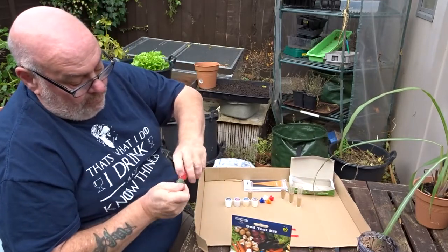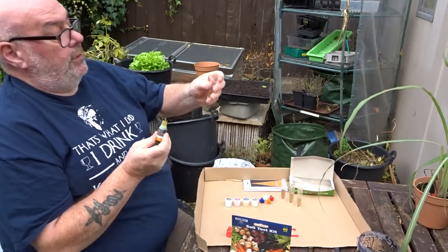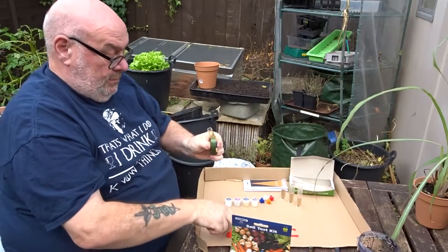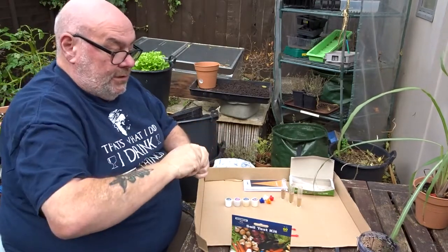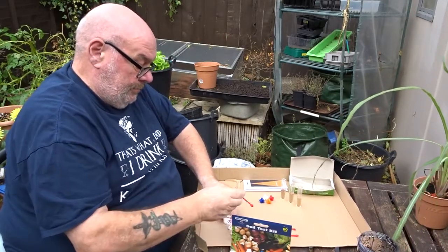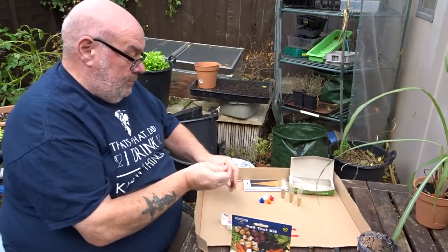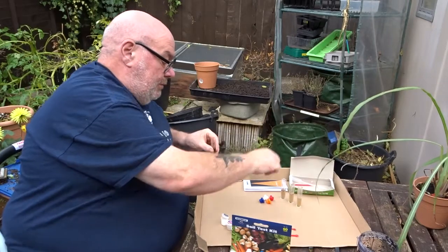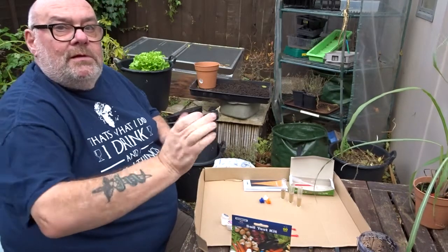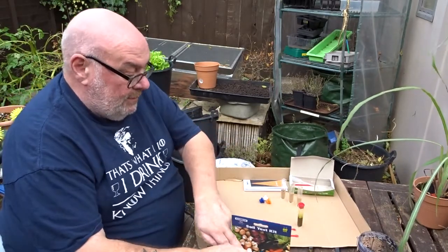What we've got to do now is half a ml of the first reagent — liquid. So half a ml takes it up to 3.5. There's enough for 60 tests in here, so it's pretty good. And then a heaped scoop of the pH powder. Pop it in. pH is red so we've got the red lid on. Give it a good shake — shake for 30 seconds. Leave that for 5 minutes.